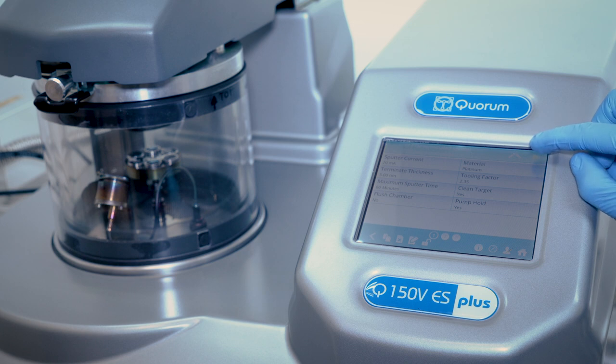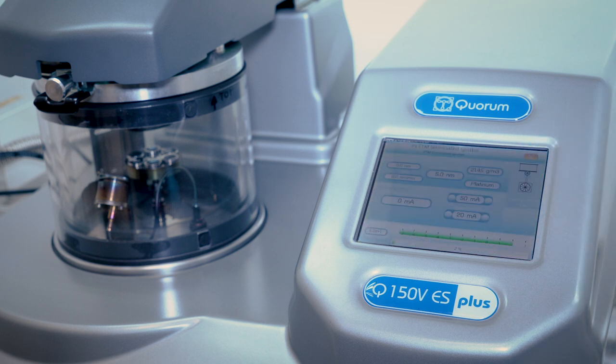When choosing a new recipe, the system prompts user to confirm target material and it then automatically selects appropriate parameters. We can edit the parameters if needed. The machine is now ready to run a coating with a new metal target.